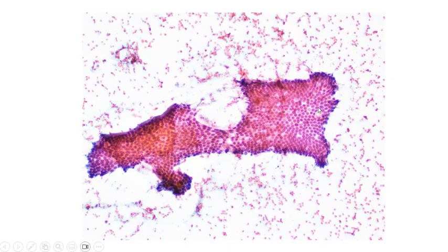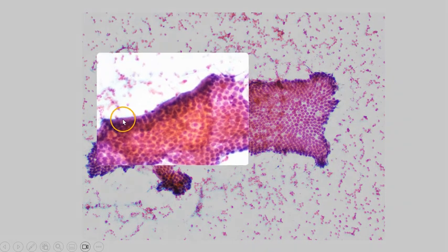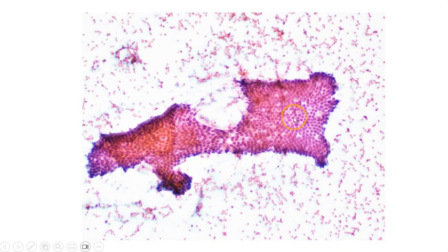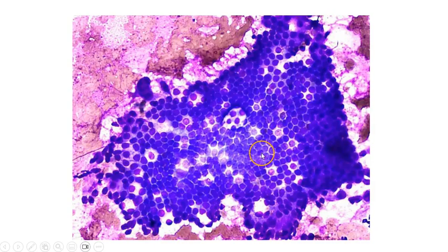This is one of the commonest things that we will see, and we can see a flat honeycomb sheet of glandular cells. And over here at this edge, we are able to see that the cells are actually columnar in shape. The nuclei are extremely uniform and very regularly arranged. And we can also see these empty holes or spots that overlie the sheet of epithelium. These are goblet cells. Here is the air-dried smear. Again, we can see a honeycomb sheet of uniform cells with round nuclei and these empty spaces which actually represent goblets.